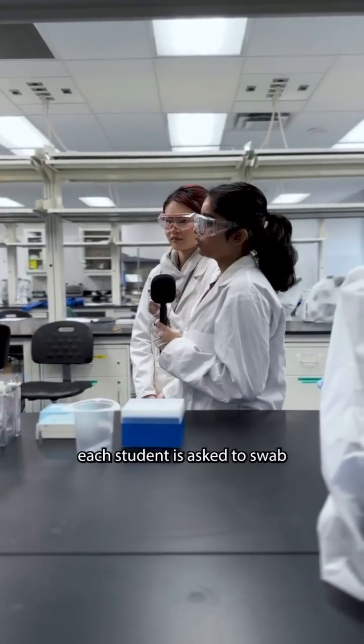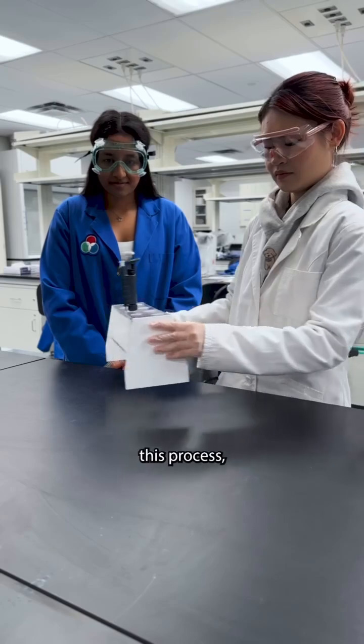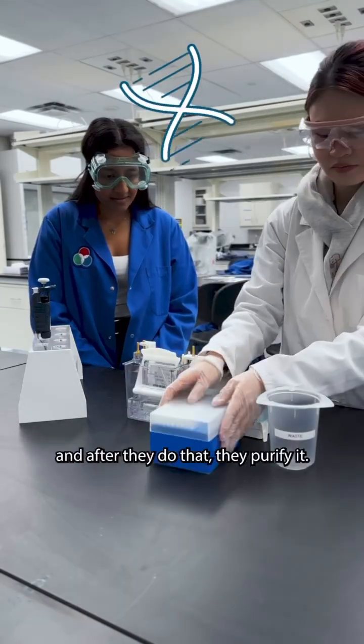So the first step, each student is asked to swab the inside of their cheeks. This process takes out some of their cells and after they do that, they purify it.